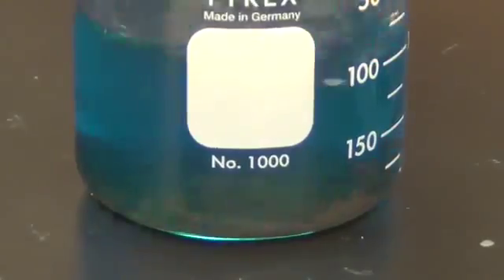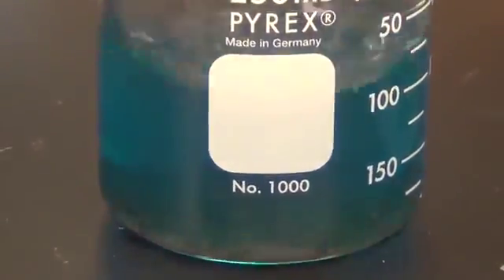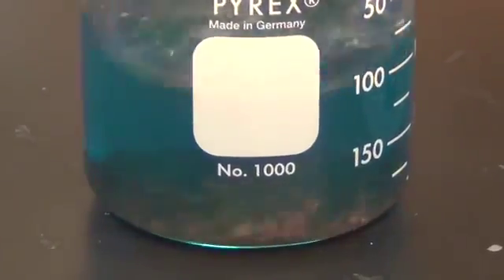Is that brown? Looks brown. This is a much better trial than yesterday.